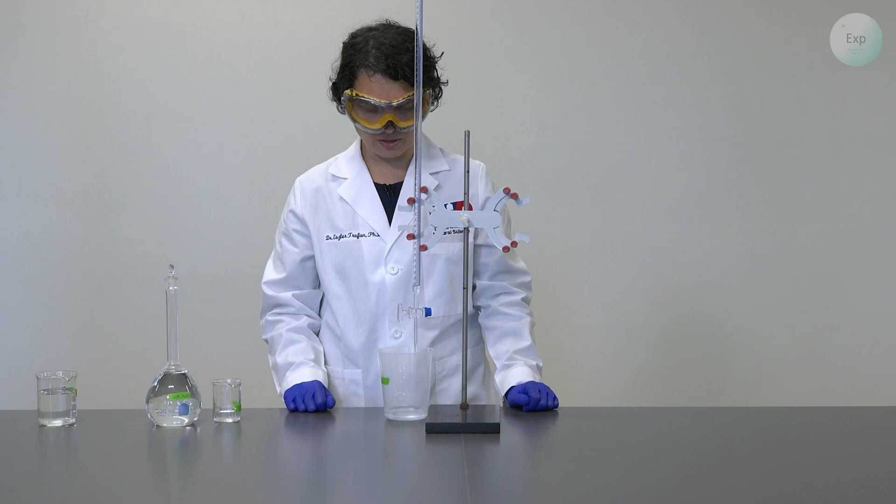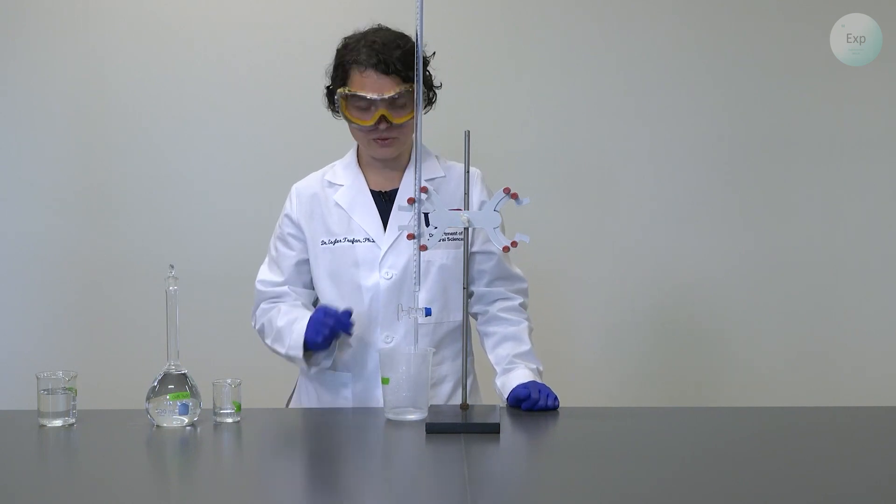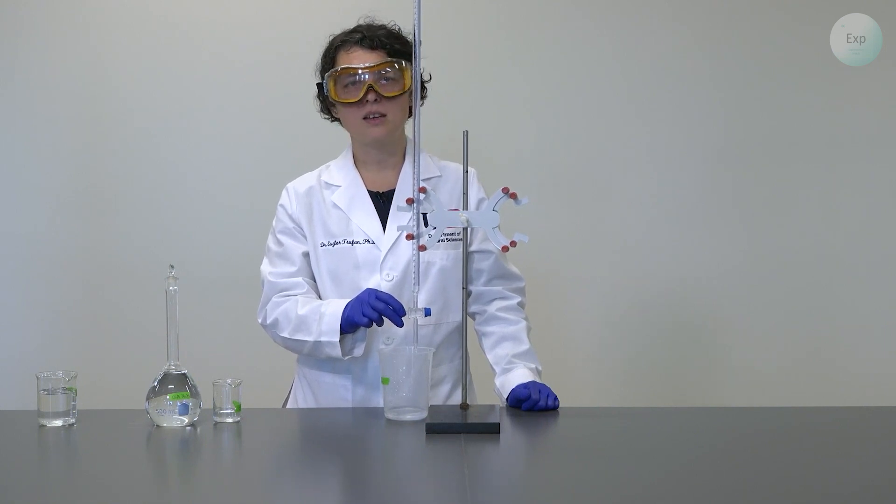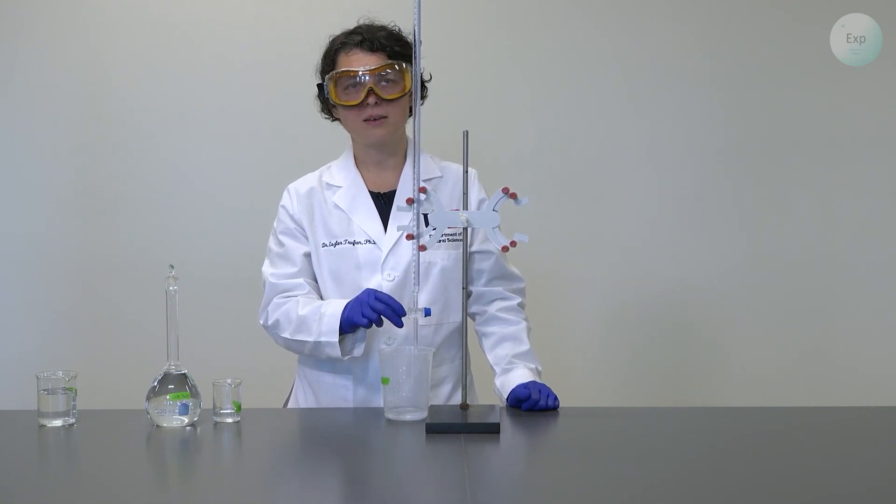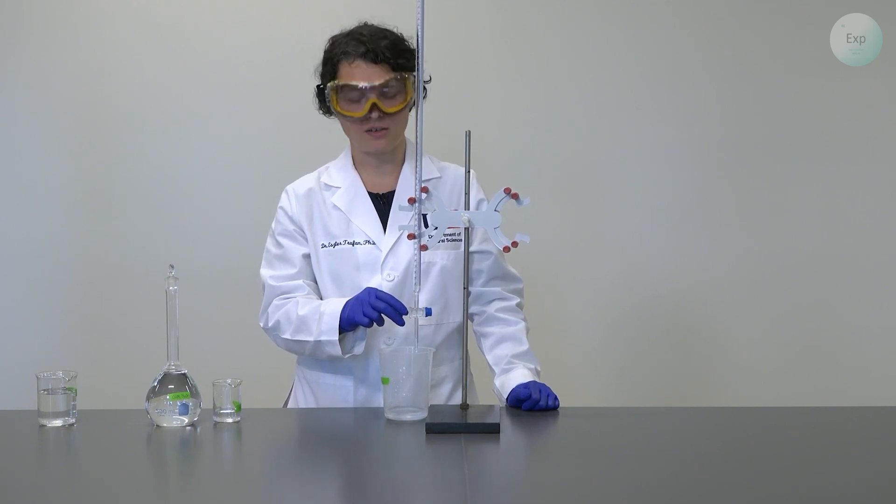This is also a good time to realize whether or not your burette is working appropriately. If you're unable to get all the different addition modes, it is a good time to evaluate the functionality of your burette and adjust before you begin any of your titrations.